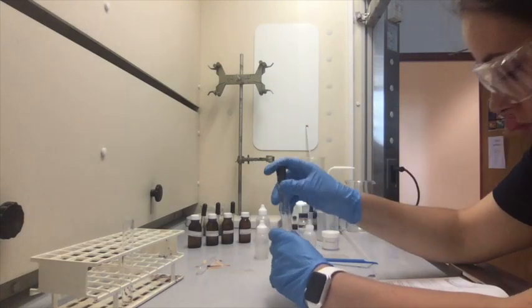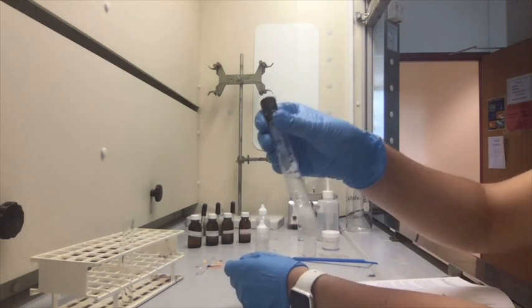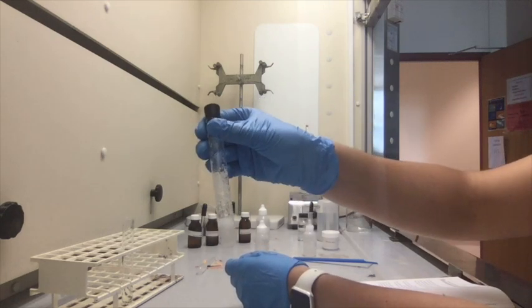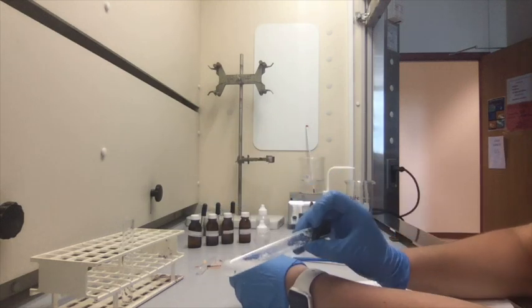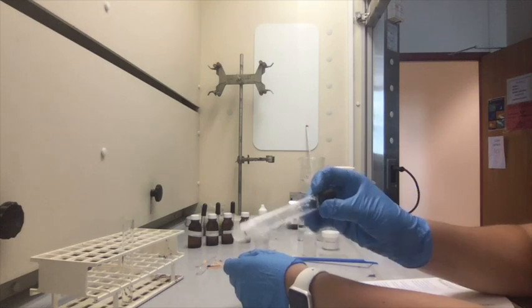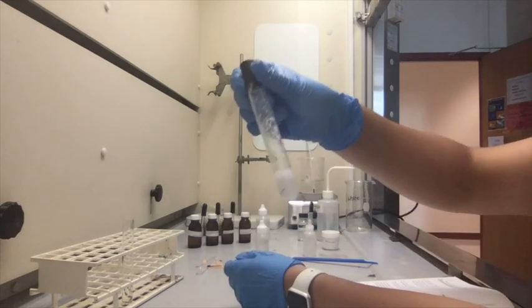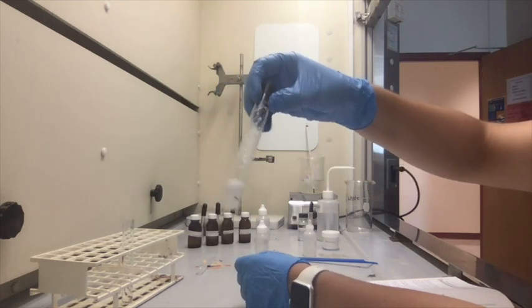What happens to the solid? It mixes a little bit. But there's still quite a bit of solid in the test tube, and I really mixed it. It kind of clumped up a bit, though. Instead of being like little crystals, it's more chunky now.